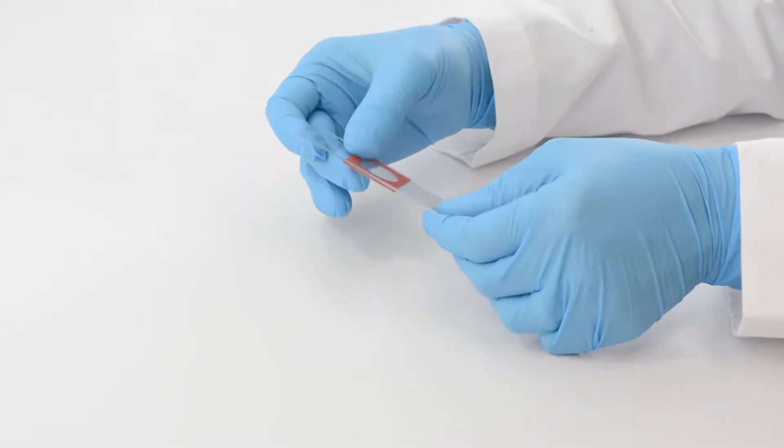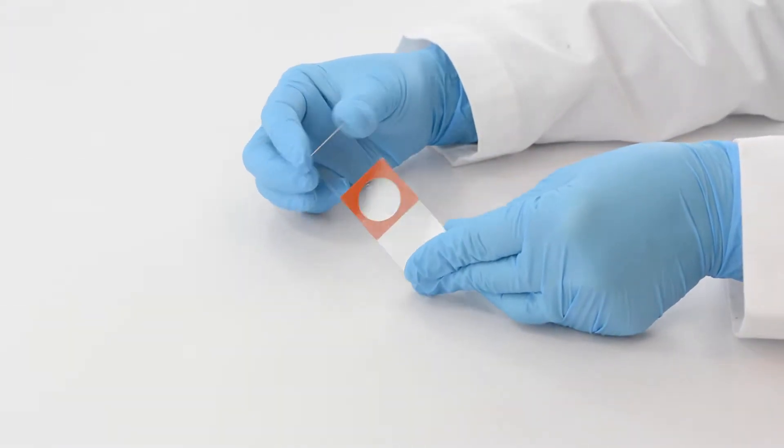After applying the chamber to the slide, check to see that the seal is complete around the edges.